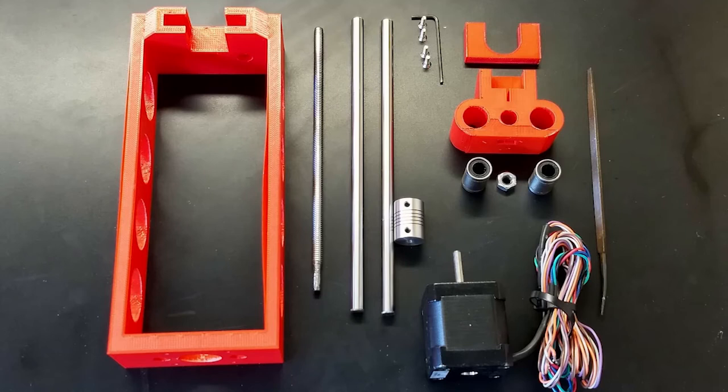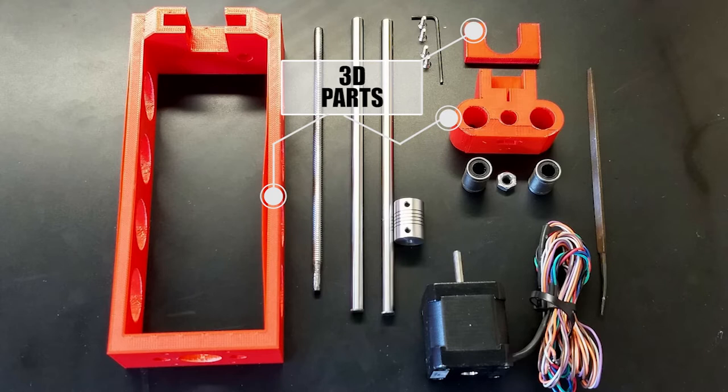In this video I'll be using the following parts. The 3D printed components, you can get the files for these from our website.